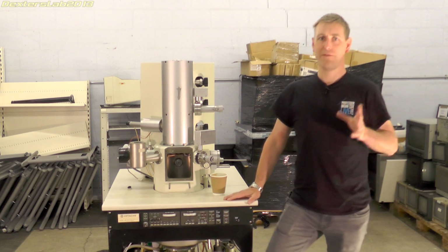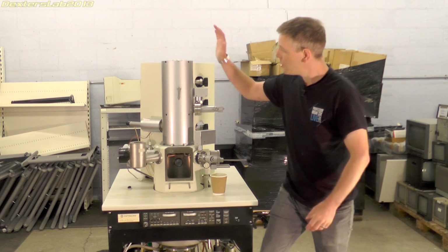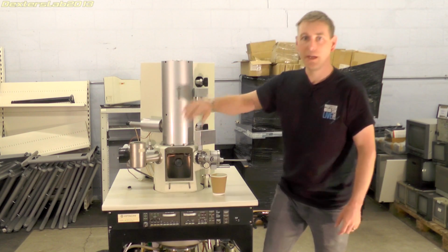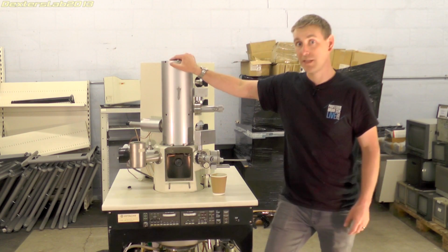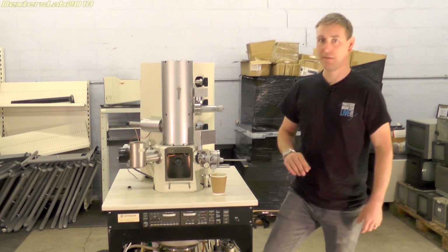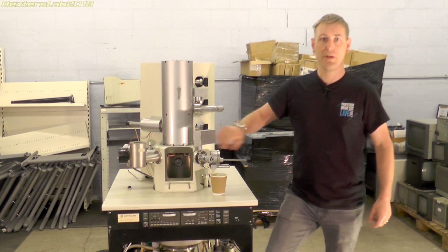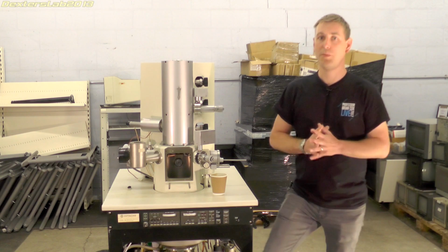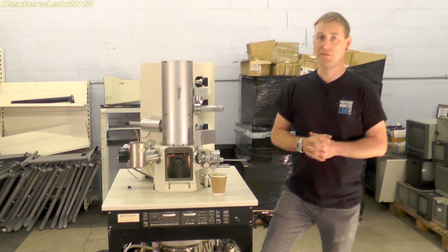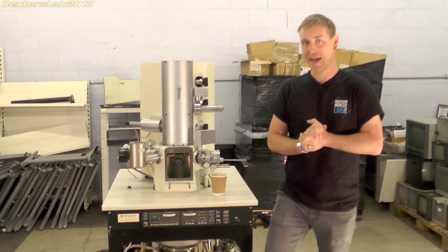I will be removing many of the components from the base of this unit. I'll be removing the electron gun and the column assembly from the sample chamber, which is here, and the ion pumps which this contains. So it will end up with the chassis, the main vacuum pump, which is down in there, the sample chamber, which will all go up on eBay as a whole. It could make a perfect starting point for someone wanting to get into high vacuum, but it will be still quite big and heavy.